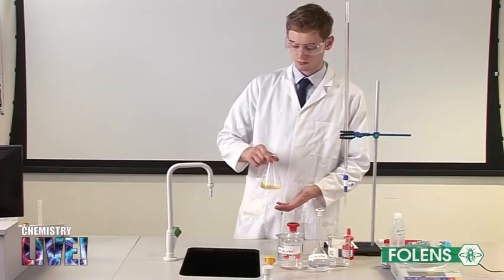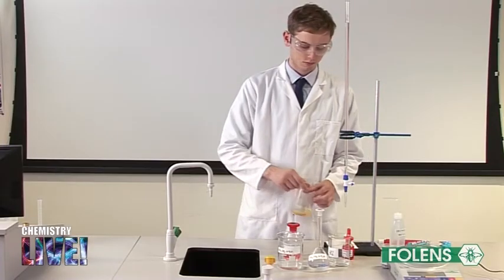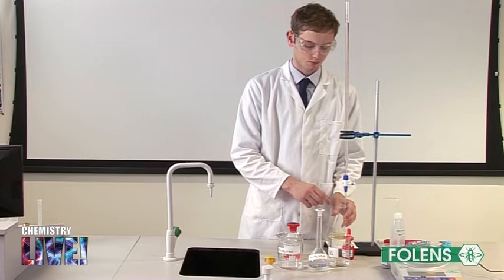With the white tile in place, titrate in the usual manner until the yellow color of the methyl orange changes to pink.